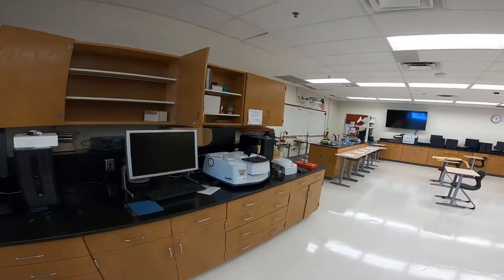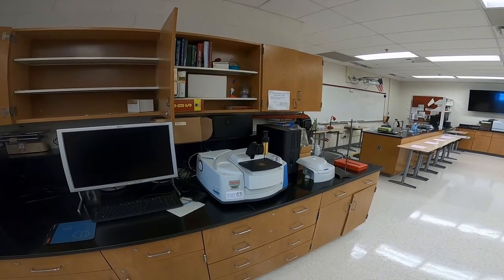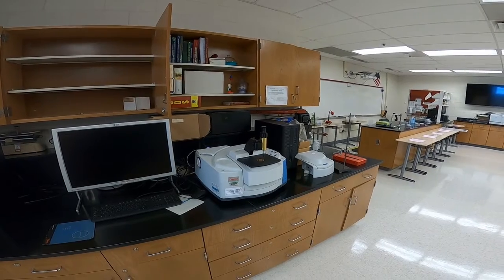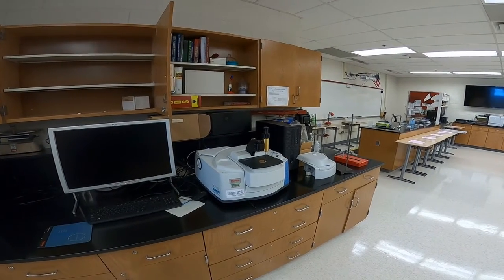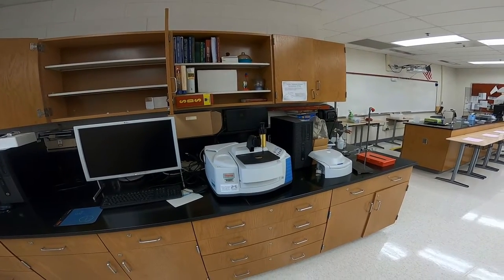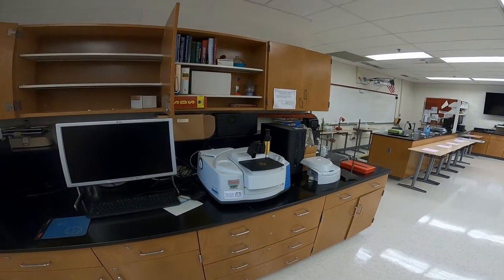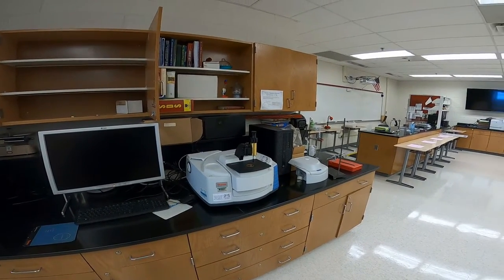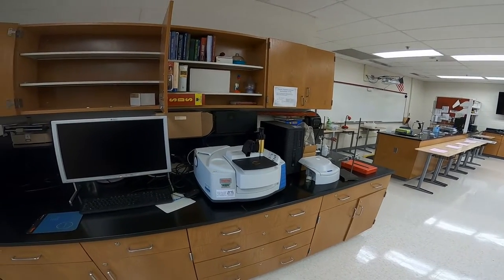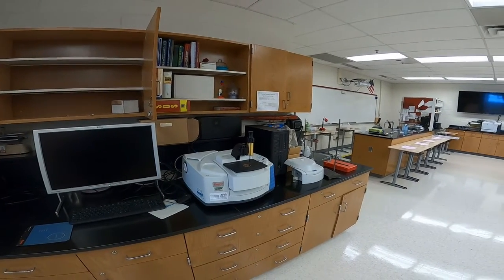Then over here we have what's called a Fourier transform infrared spectrometer, and what this can be used for is to determine functional groups of molecules. And how it basically performs is, as you pass IR radiation through a sample, some of that radiation is going to be absorbed by the different types of bonds within a molecule. A simple example would be an alcohol would be a higher energy bond than a carbonyl, and they would have peaks in different locations, and based on those peaks or the absence of those peaks, it gives you an introductory idea as to what kind of molecule might be in your sample.